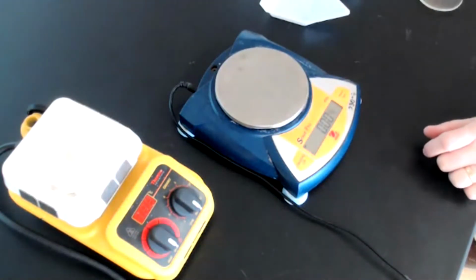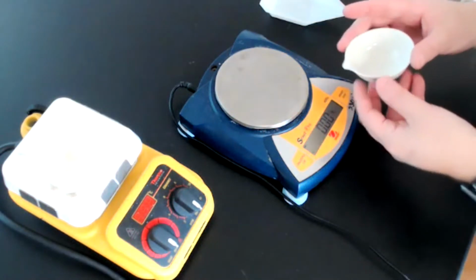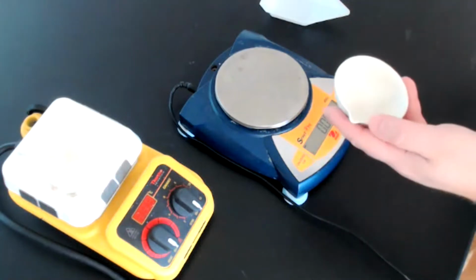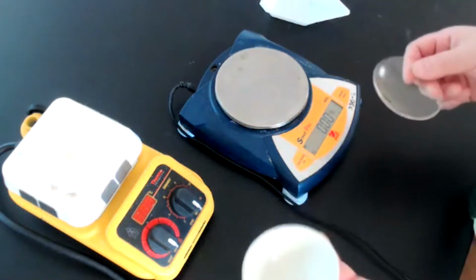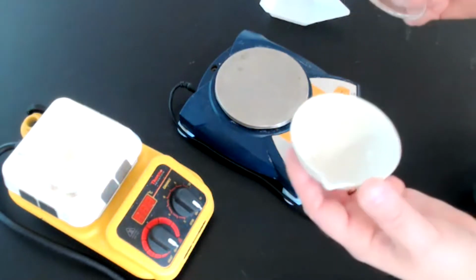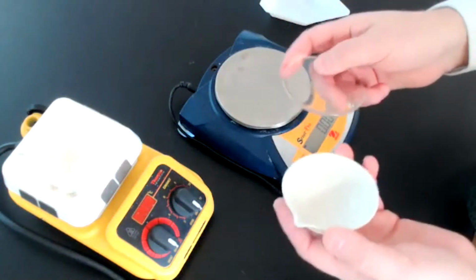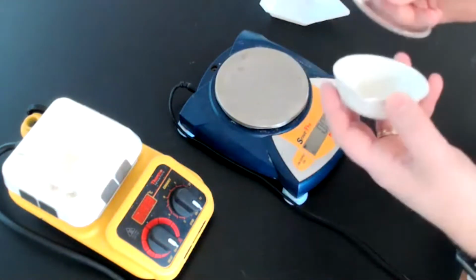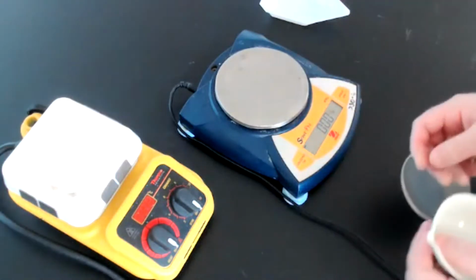So in step number 1, it says obtain the mass of a dry evaporating dish and watch glass and record the mass in your data table. So at this point, here is our evaporating dish, which is dry, and here is our watch glass. And the reason why we're getting the mass of both the evaporating dish and the watch glass is that when we are done with our reaction, our watch glass is going to be completely coated with material, so we will not be able to get its mass separate from each other. So we're going to get the mass of both of these together.